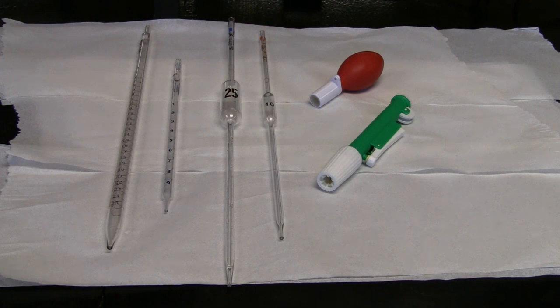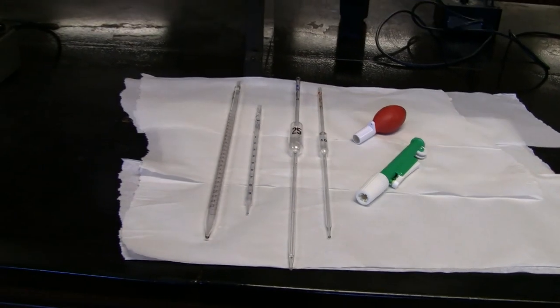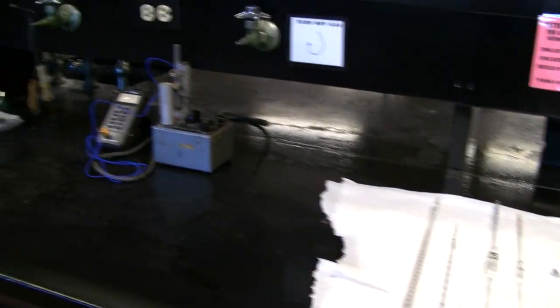Before using the pipette to obtain experimental data, you should practice a few times with water. This allows you to get a feel for how to use the pipette.